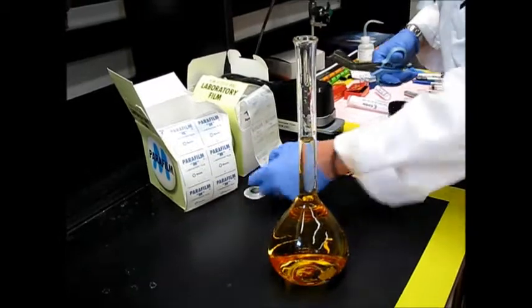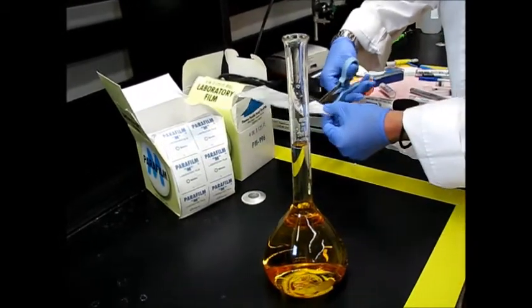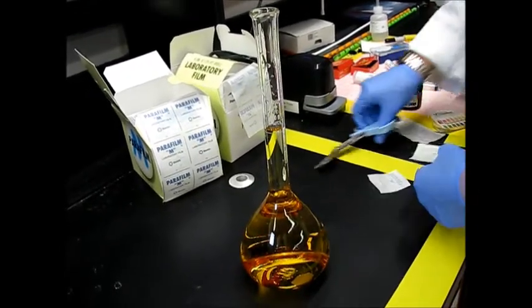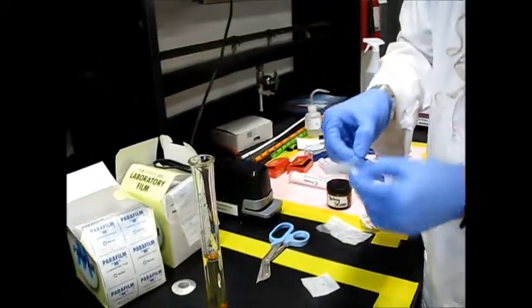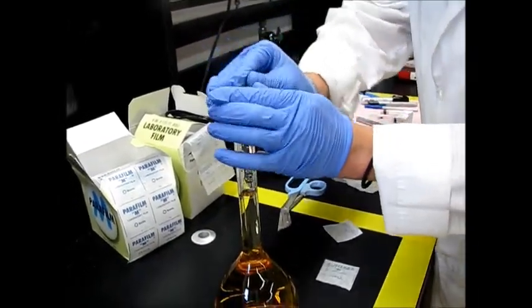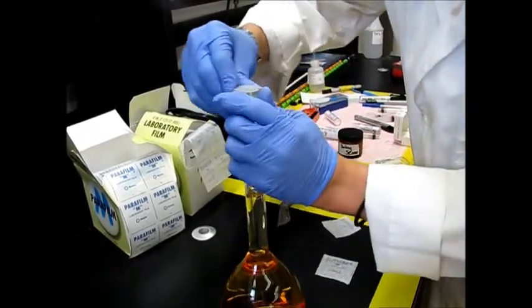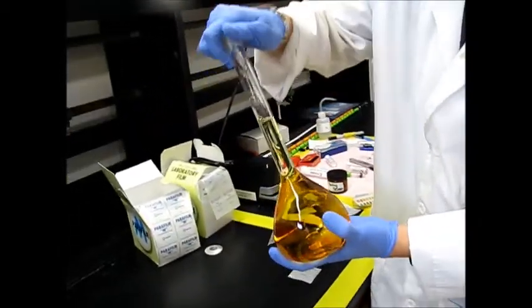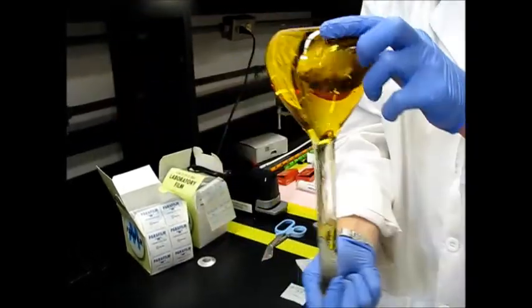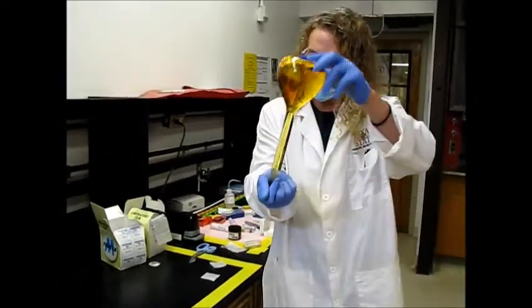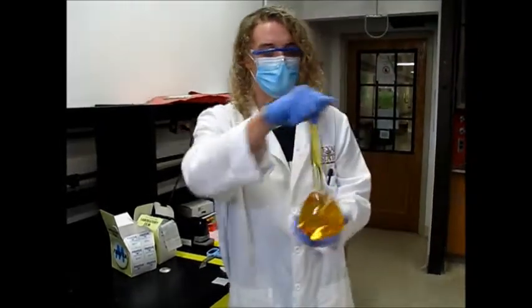We want to use the side that was up against the paper so that we don't introduce any kind of contaminants into the flask. Try to get a good seal on it, just like this. Now the best way to mix these, you're not going to be able to really mix it like this. So what you want to do is use this air bubble. You'll invert it and then re-invert it. So you'll go back and forth. This is how you mix your quantitative solutions. So we'll mix until all of these little solid bits are gone, and then we'll be able to do our spectroscopy.